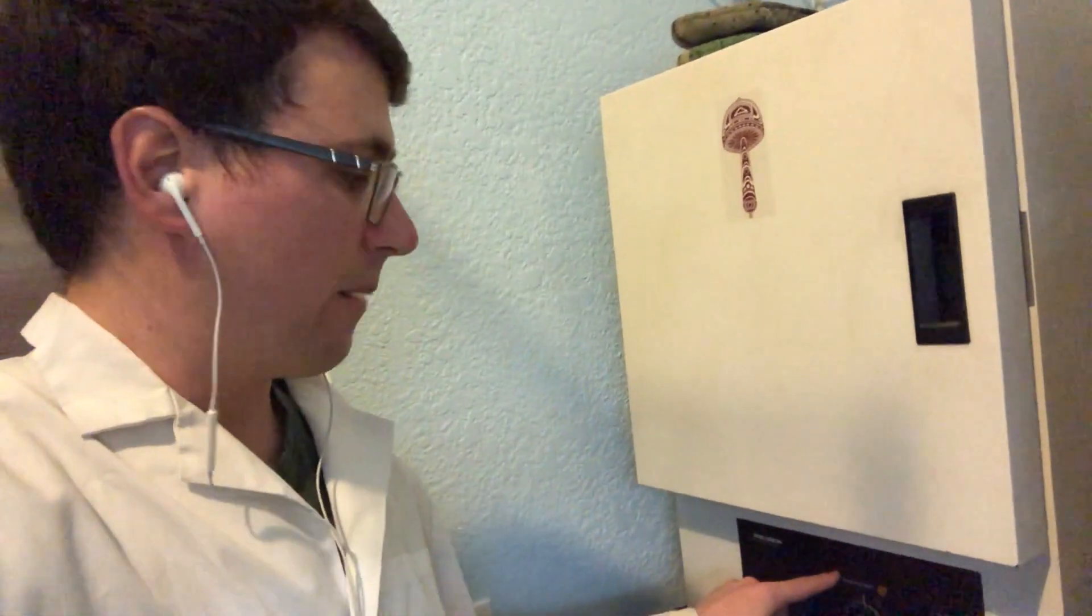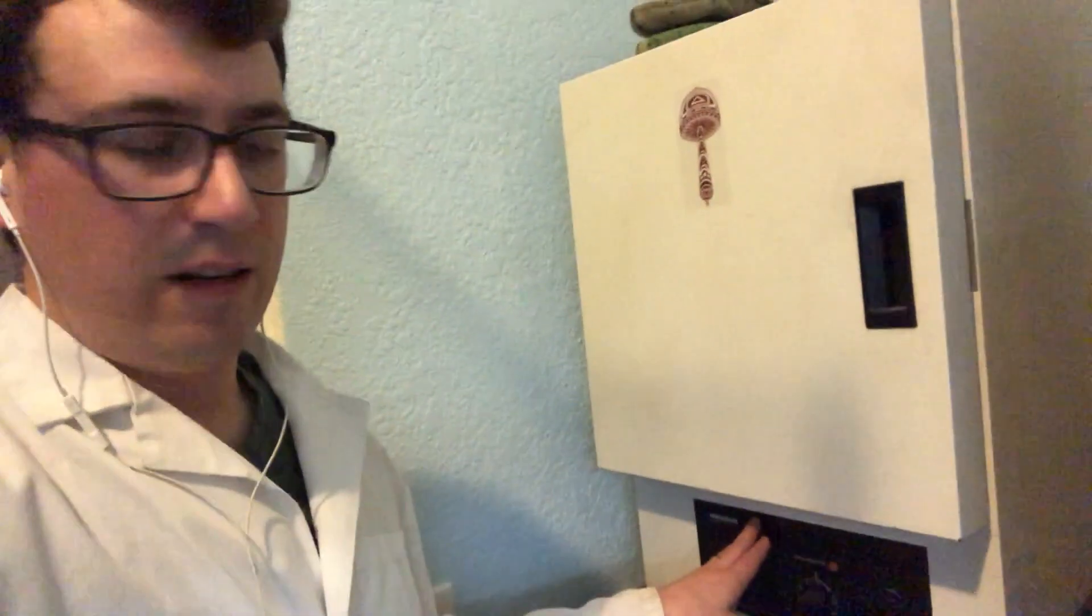Incubators are nice because they hold a really, really specific temperature. So I have mine set right here. It has an analog dial. It's set for 72 to 73 degrees.